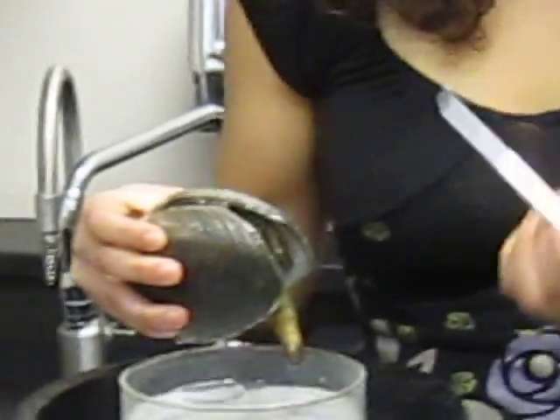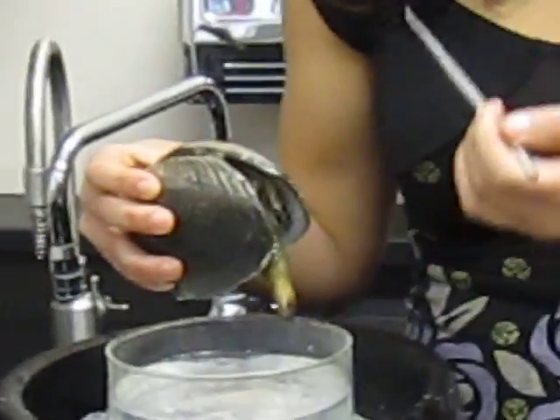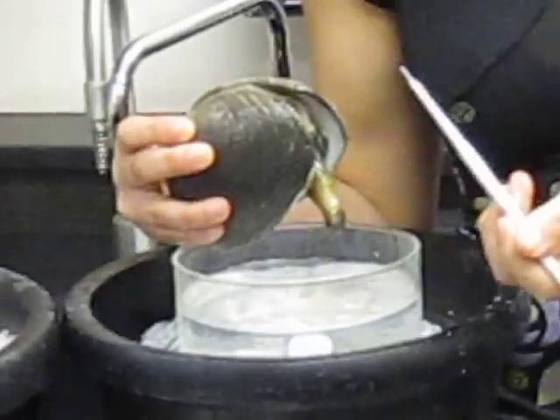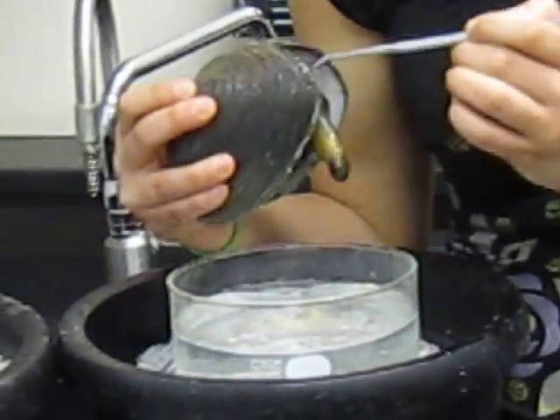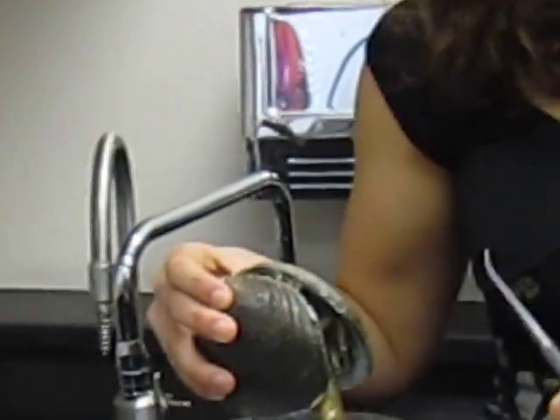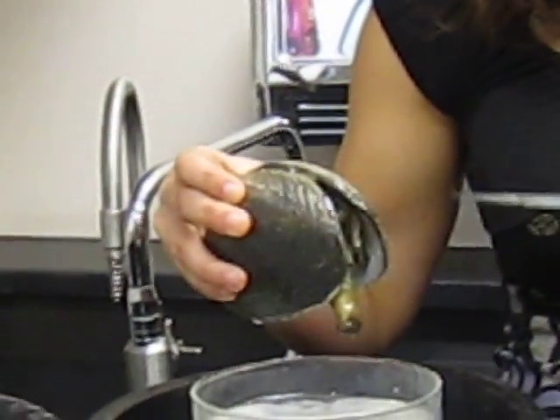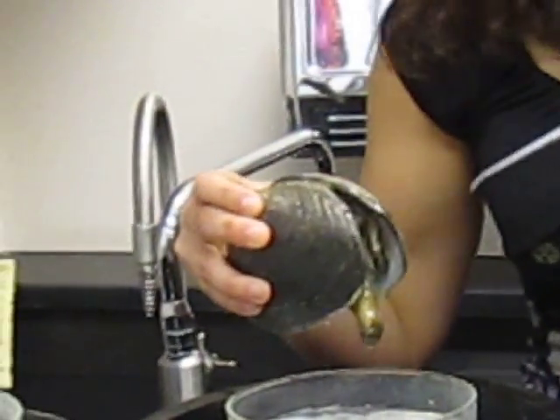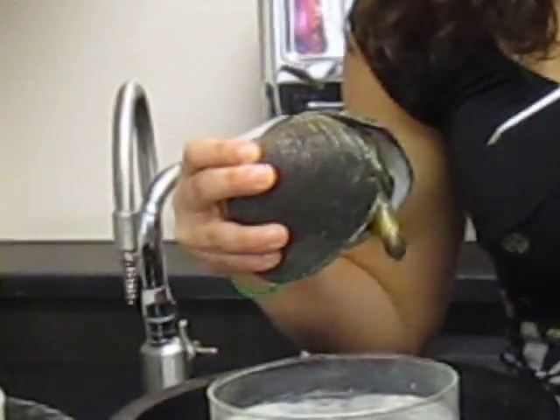Okay, so then after it goes through the stomach, it'll go through the intestine, and then intestine to rectum, rectum to anus, and then the anus will basically allow it to go out through the external side, which is, like we said, which part of the clam? Dorsal. Yeah, so out.